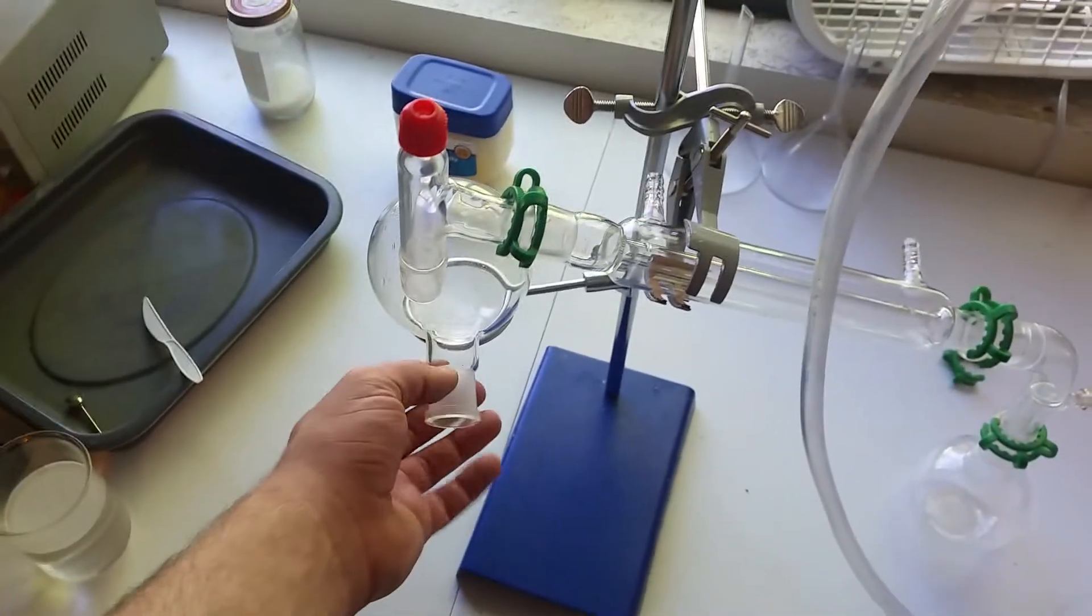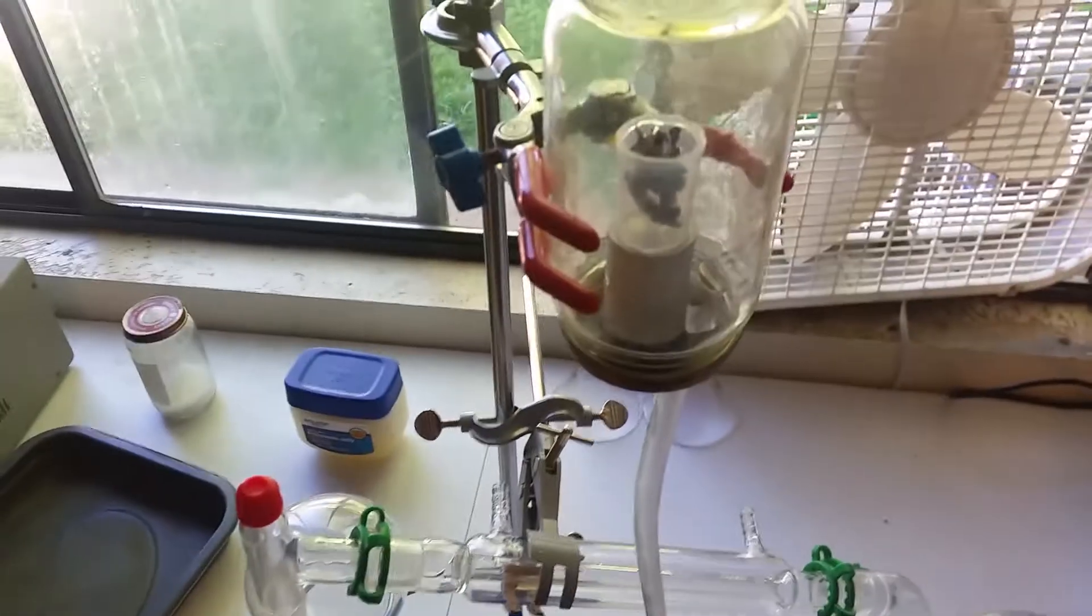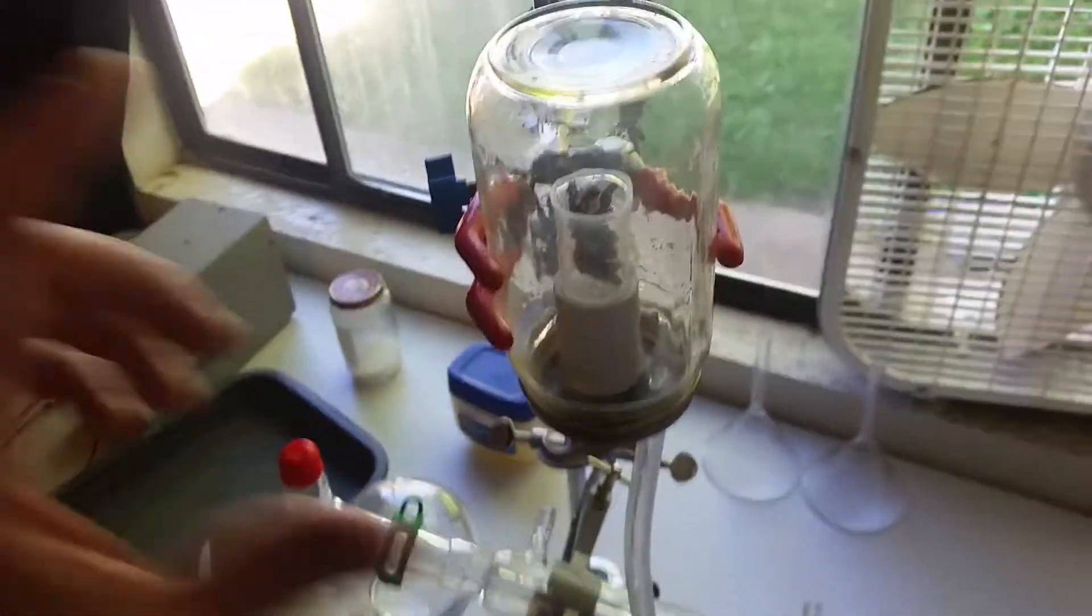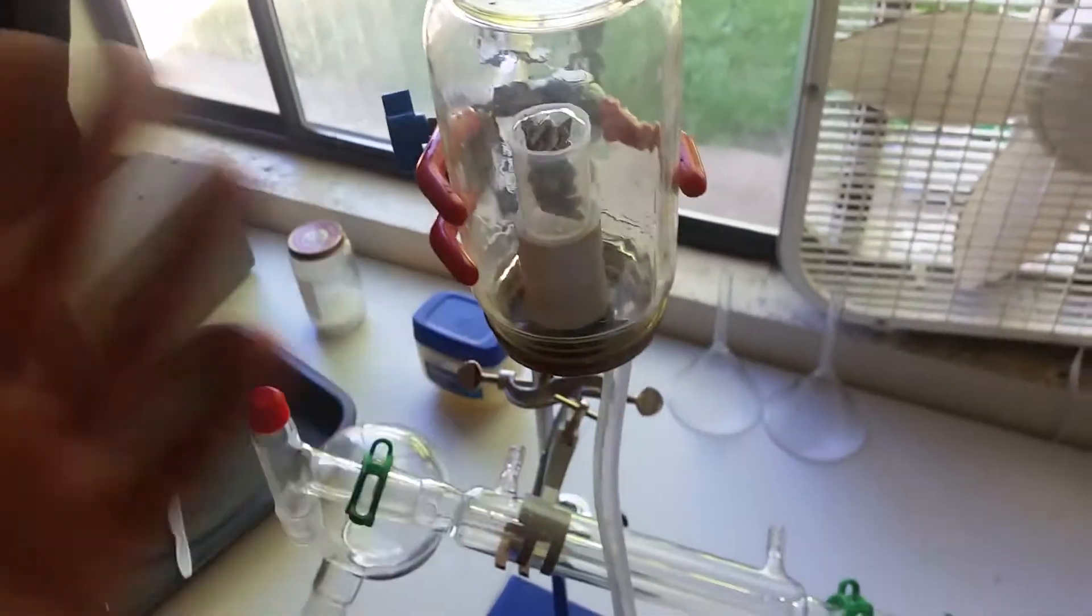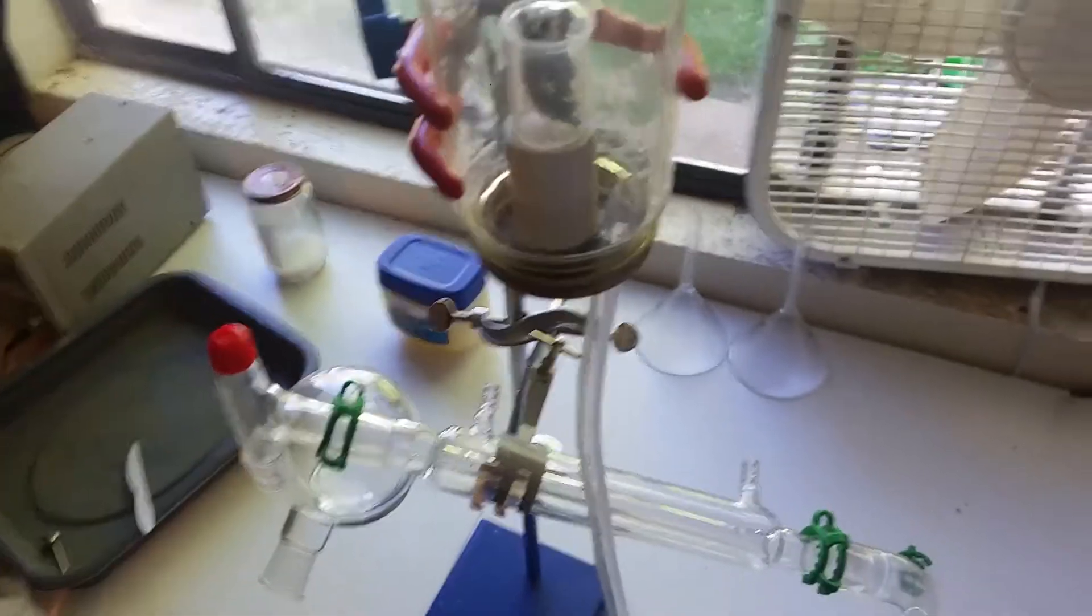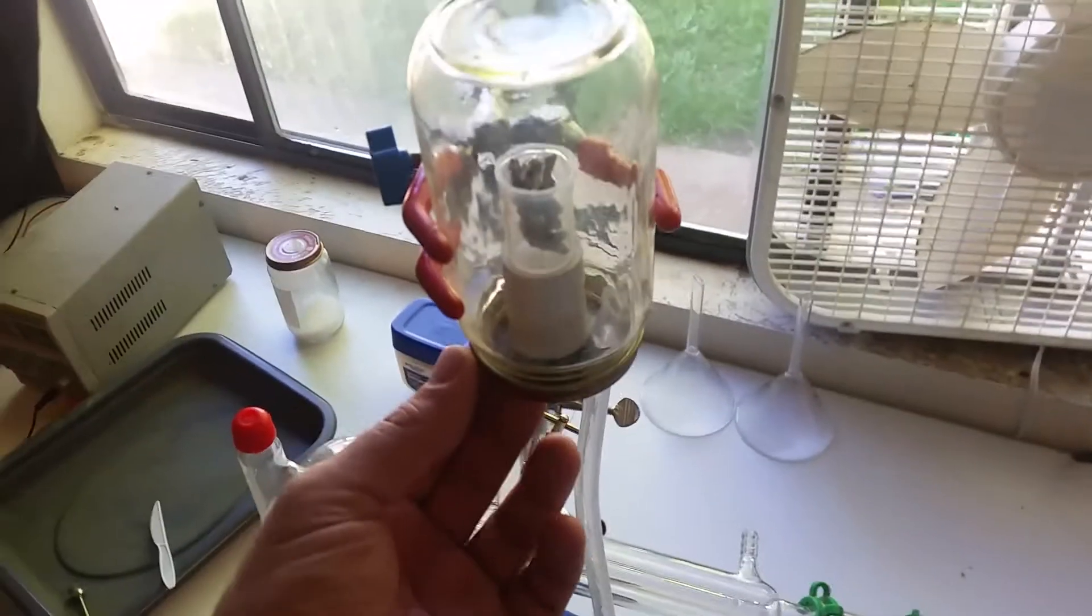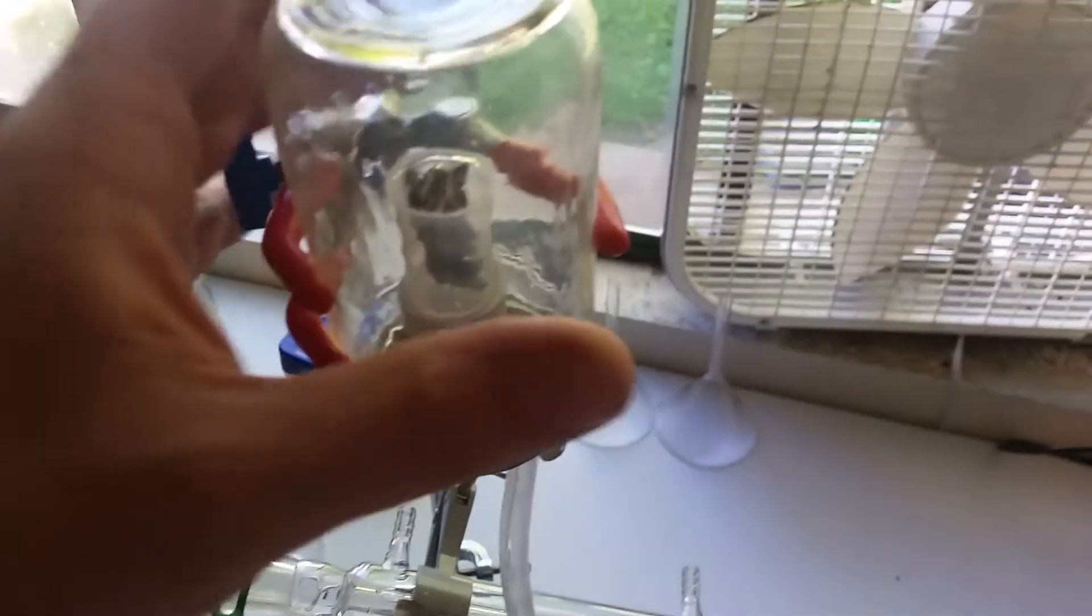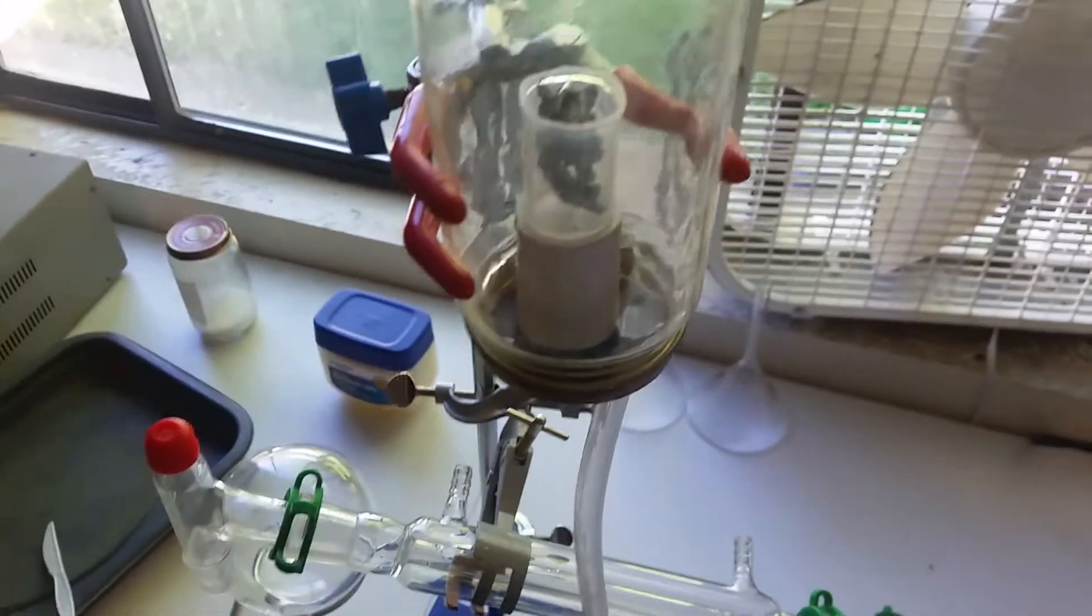Now I'm willing to bet that I'm going to have to start this reaction several times because they let this go for two hours. And that was at two bar or roughly double atmospheric pressure. And I'm going to be running at normal atmospheric pressure. So I'm willing to bet it's going to take a little bit longer. I don't know how fast it's going to run or how it's going to look, but we're going to find out.